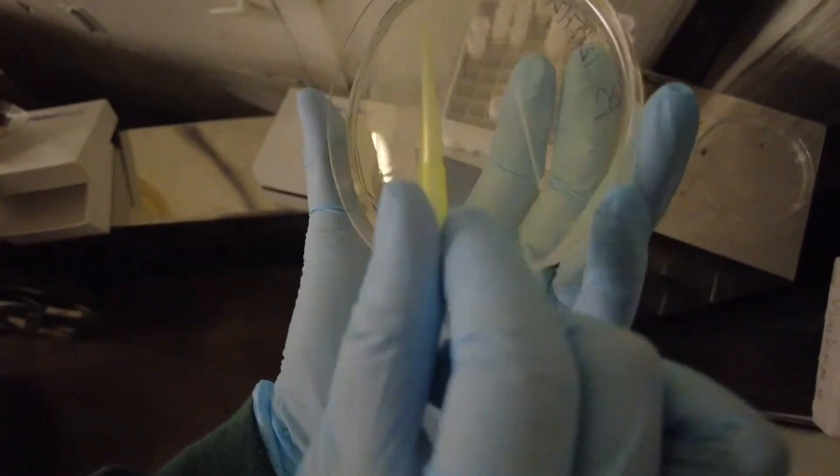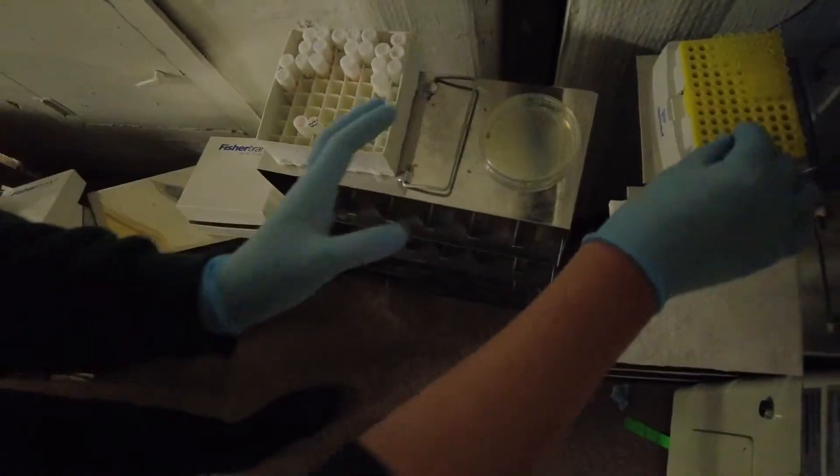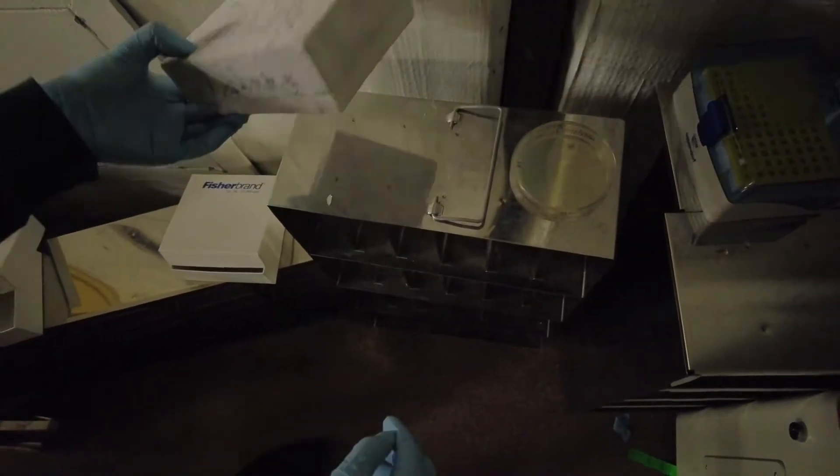It's okay to streak like heavy streaks now because we can streak out for single colonies later. For you, you probably don't even need single colonies. I'll show you how to do single colonies in a minute.